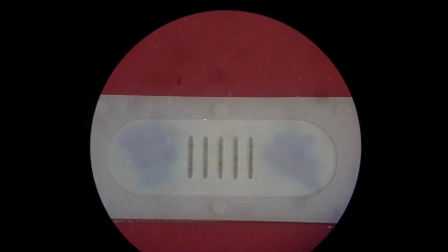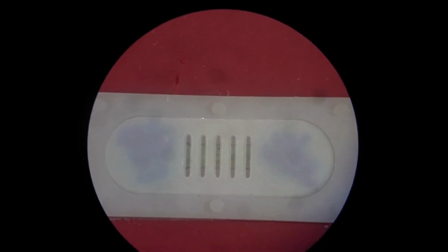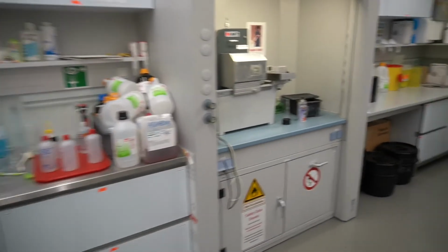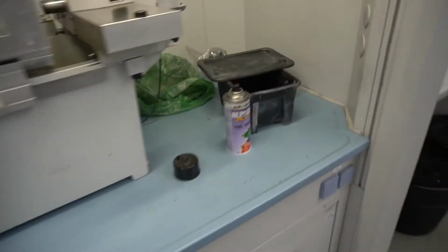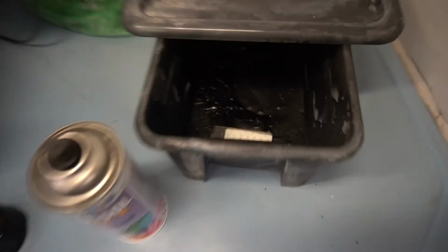We added the masks, and here you can see these 5 lines which are spaced 1 mm apart to allow the optical strain tracking. In order to hold the mask in place, I added a lid, and now the sample is ready to be speckle patterned. And here we go to our box where we apply the speckle pattern.